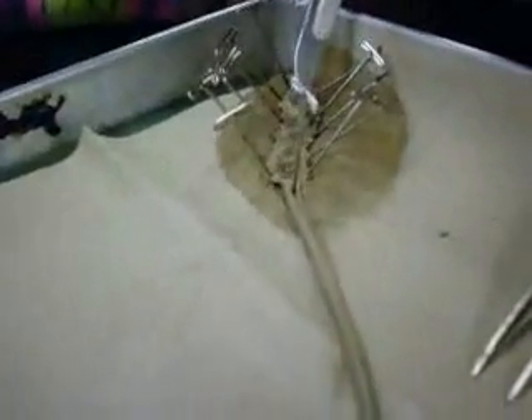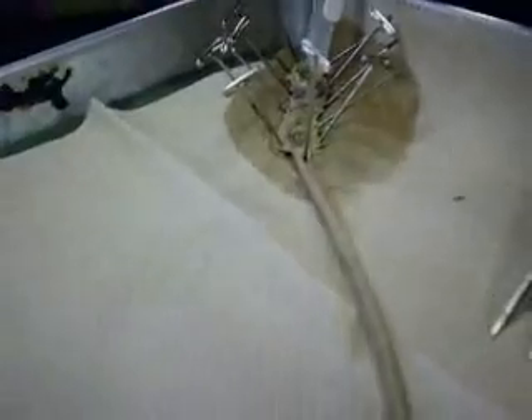I want to cut up and down here and see the black line. That's right there — technically it's mud, but you know, it's dried-in mud. I want to cut up the rest of it. What's that yellow part? Those are the hearts. They have little hearts.